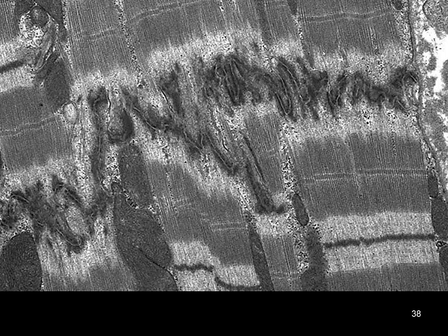Once again, as we follow our sarcomeric pattern, we have our I band with the Z disc, A band, and as we approach the next I band, we no longer have a Z disc, but we have this very irregular, jagged stair step. This is our intercalated disc. Some of these are darker than others. Some of these are going to represent gap junctions.